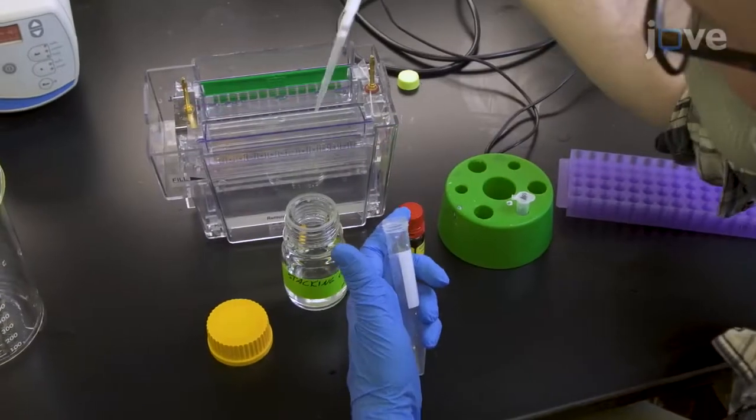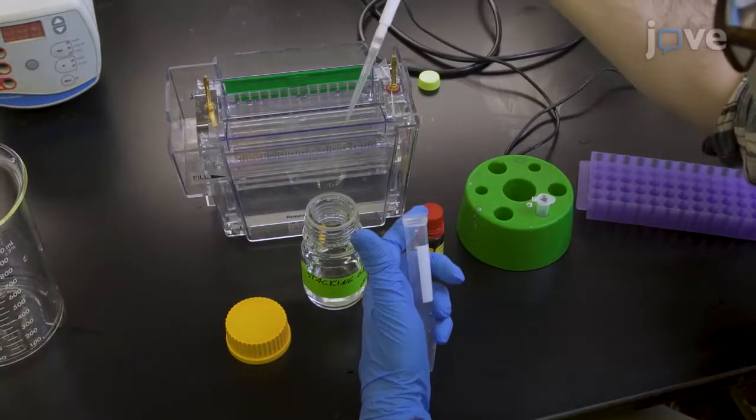Use a pipette to quickly add the stacking gel solution over the solidified resolving gel until the cassette is filled.